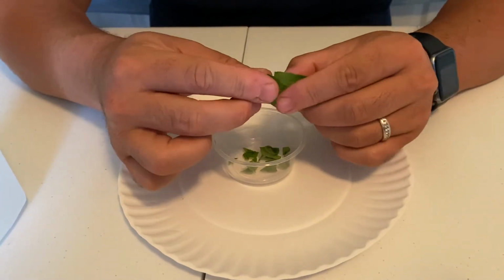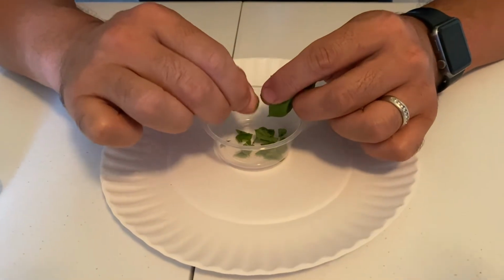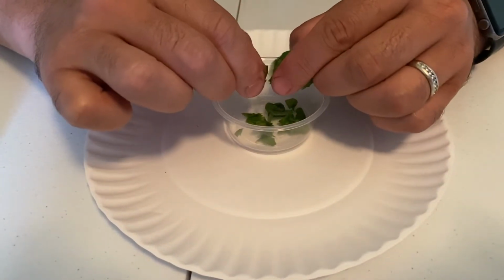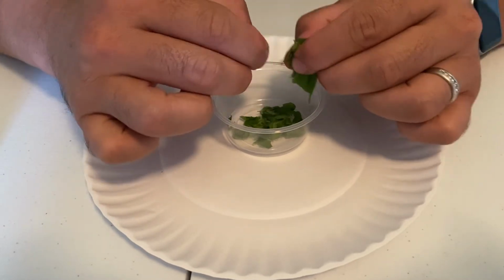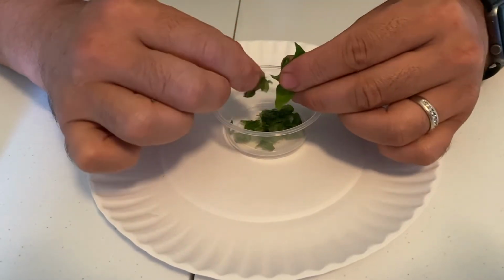The smaller the better, I would assume. But yeah, there it is. I'm just doing all three at once. If you wanted to do one at a time, it's going to take you longer, but might limit some of that sliding around. You want to rip it up into tiny little pieces.